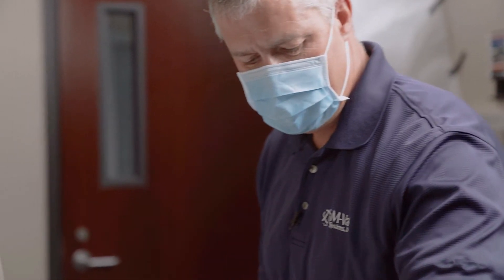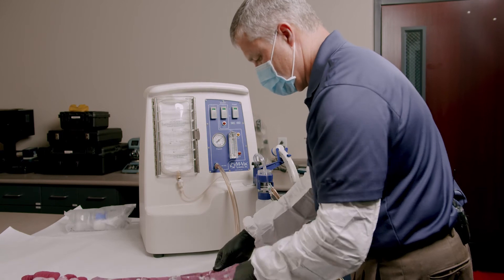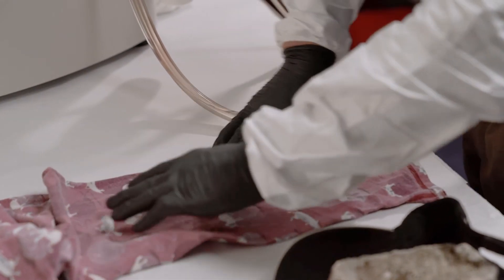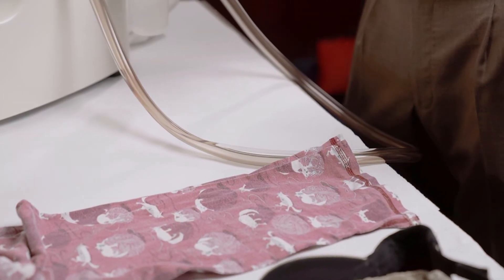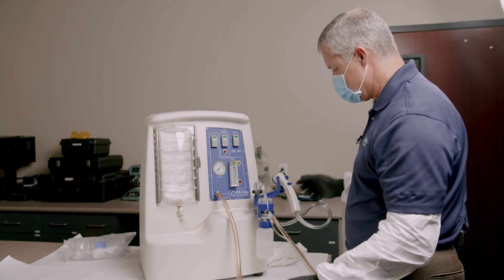Let me show you another item here. These look like pajamas. Pajamas and underclothing — things like that are pretty common evidence. A lot of homicides, rapes turned into homicides — lots of reasons to be able to collect DNA off of clothing.